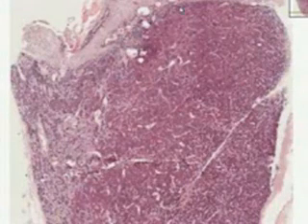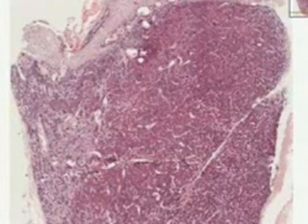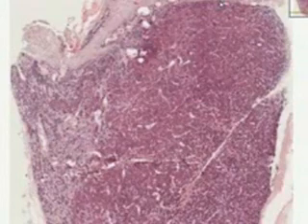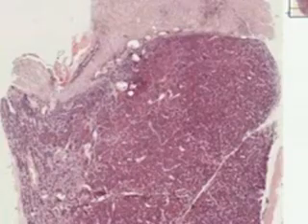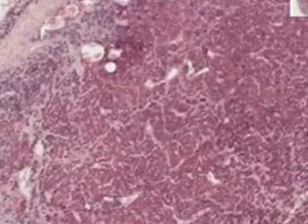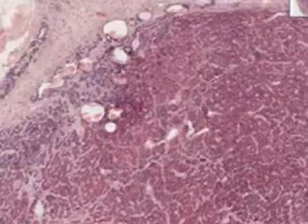There is an intermediate lobe, which is very, very minute, and classically it always looks like a couple of thyroid follicles. Basically the intermediate lobe of the pituitary is the only thing that I could think of in your entire body, which you can see here, which looks like thyroid tissue.